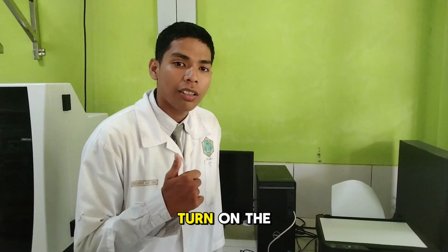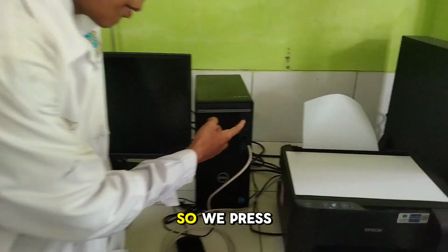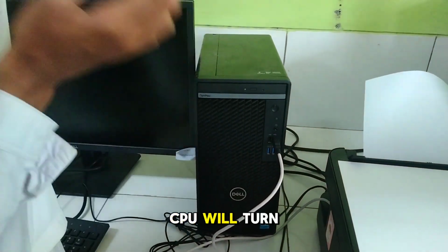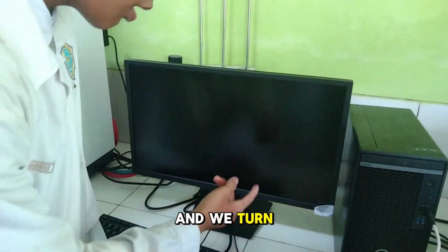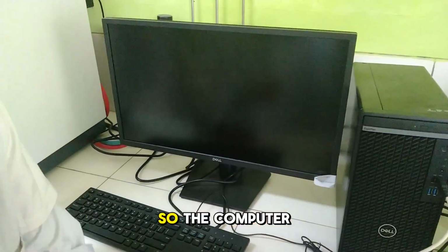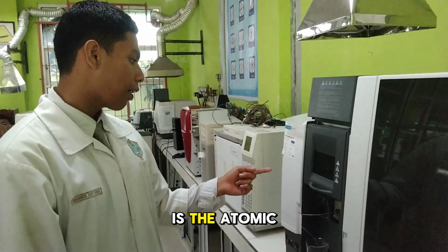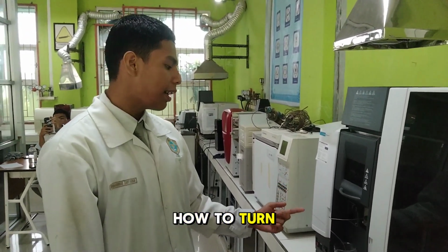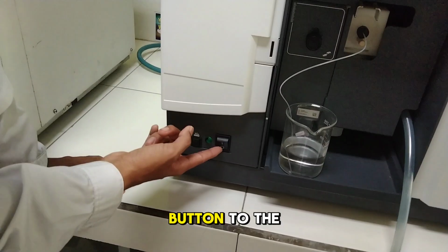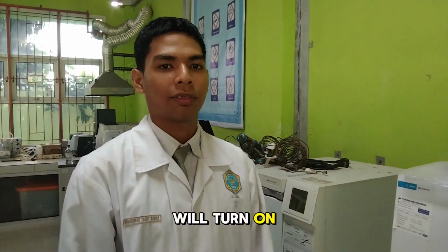After we turn on the UPS, we turn on the computer. We press this button and the CPU will turn on, and we turn on the monitor using this button here. So the computer will turn on. The next tool is the atomic absorption spectrophotometry. To turn it on, we switch this button up, and the tool will turn on.